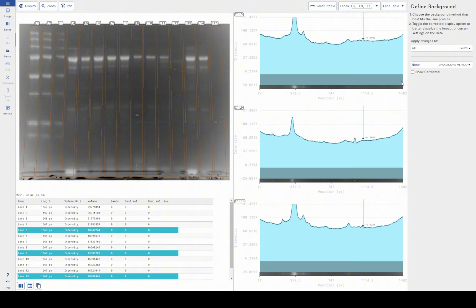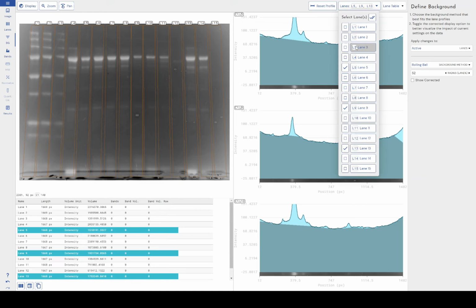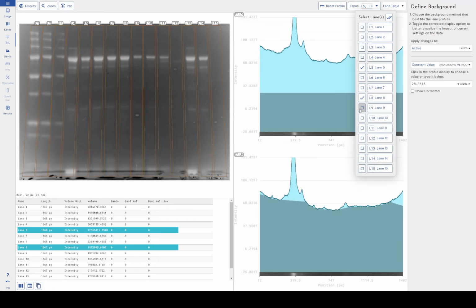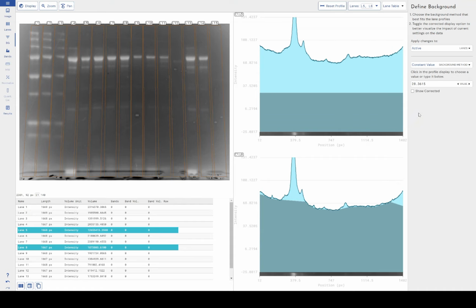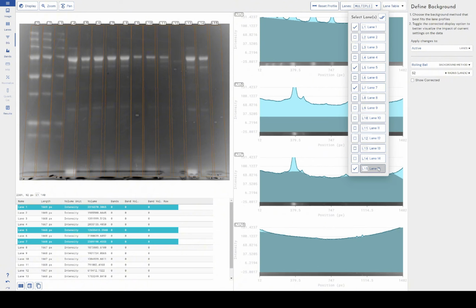So if I've got 3 different lanes going on here. If I have this setting on here, apply changes to all, the background subtraction technique and setting that I'm using will apply to all of my lanes all at once. But if I only change it to active, if I just come back to my lane 5 and change this to something very obvious, if I set the constant value very low, and I turn on my other lanes, you can see that they've still got the previous settings of a rolling ball applied to them.